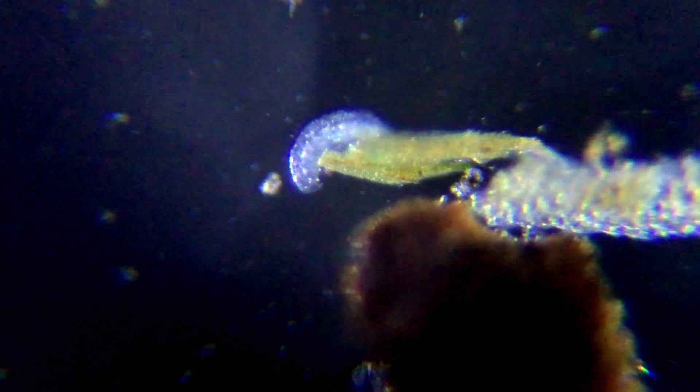With this, I find I can see the textures of everything that's moving around a lot better. It seems like more of something that I can actually relate to.